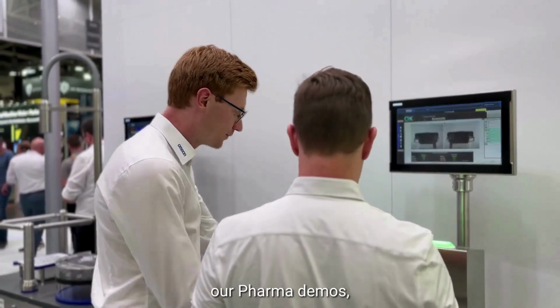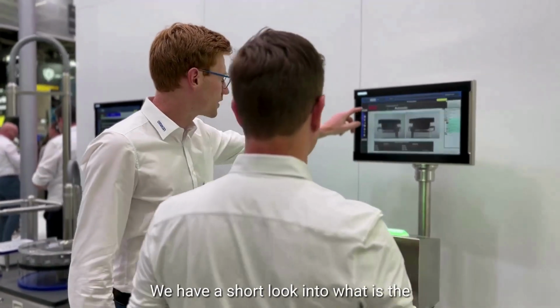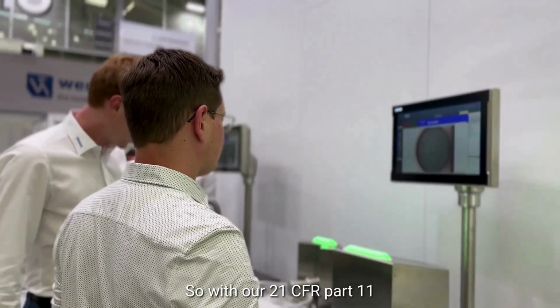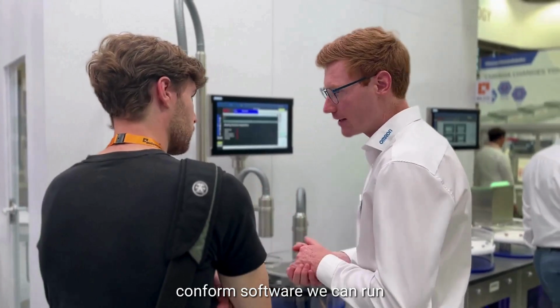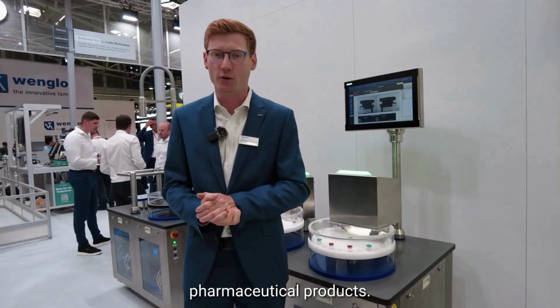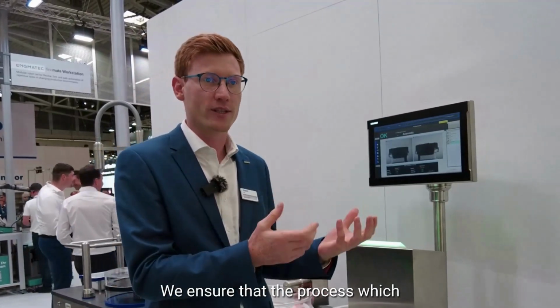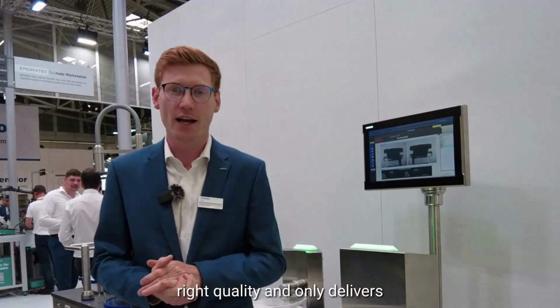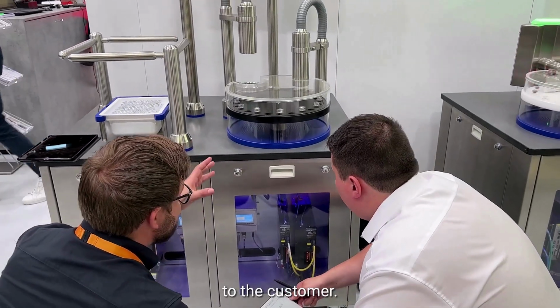We introduced our pharma demos, what we have on site. We have a short look into what is the benefit for the customer in the production. So with our 21 CFR Part 11 conform software, we can run these applications in the commercial production of pharmaceutical products. We ensure that the process which took place before is in the right quality and only delivers good products in the end to the customer.